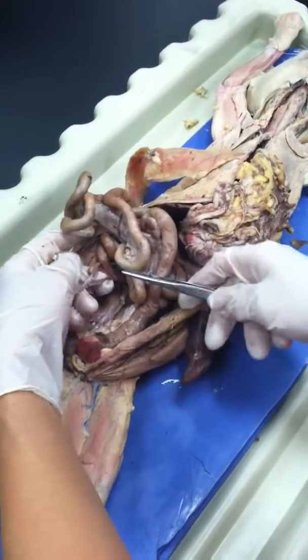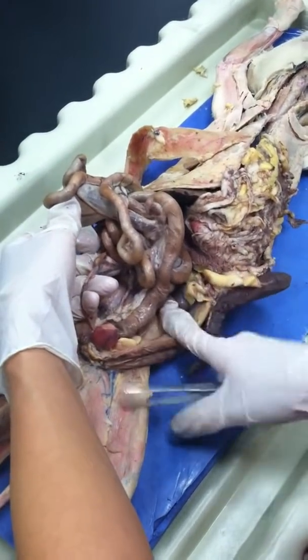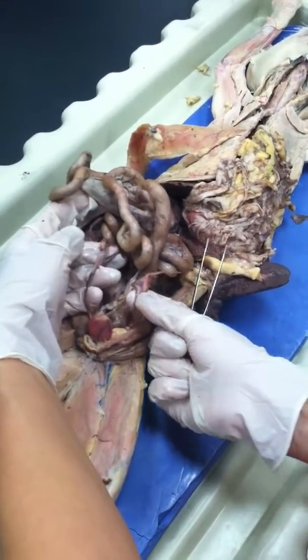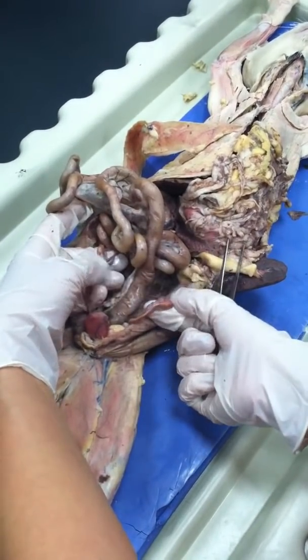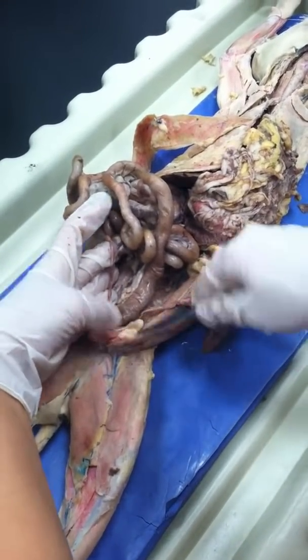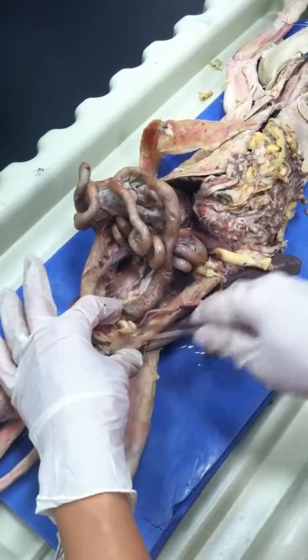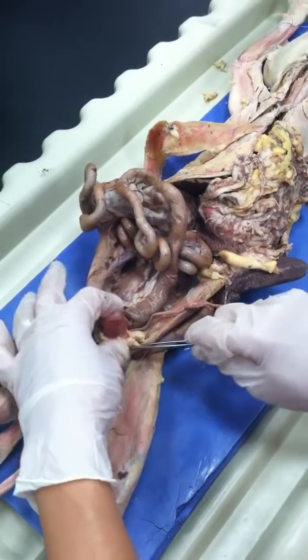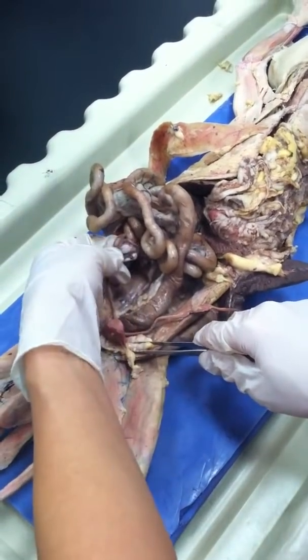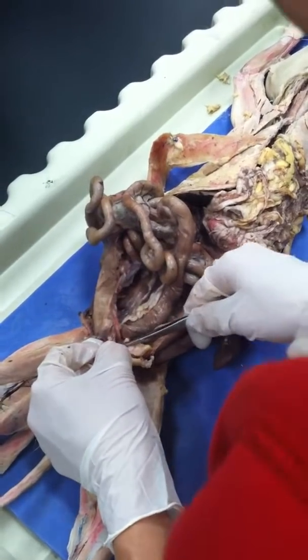Thank you. Is this an ovary? Because if you look, this one also has another ovary. We're trying to determine if it's a female or not. But it's part of the uterus. What about this thing? We thought it was a bladder. Oh, the white? That is fat. It's all fat. It's too small to be an ovary, kind of. Consider it an ovary, okay? There's one on each side.